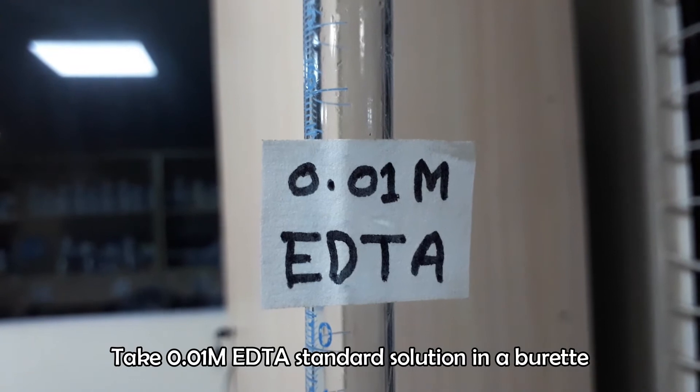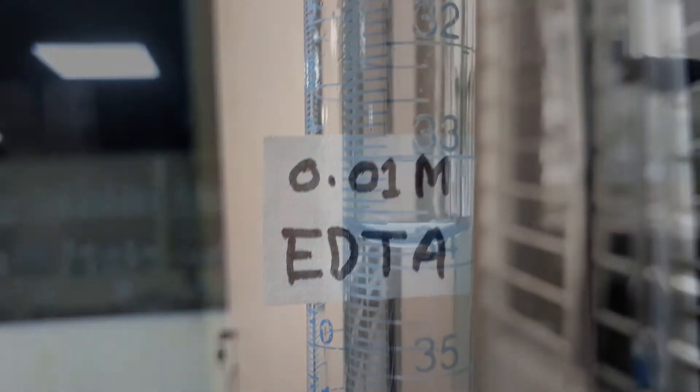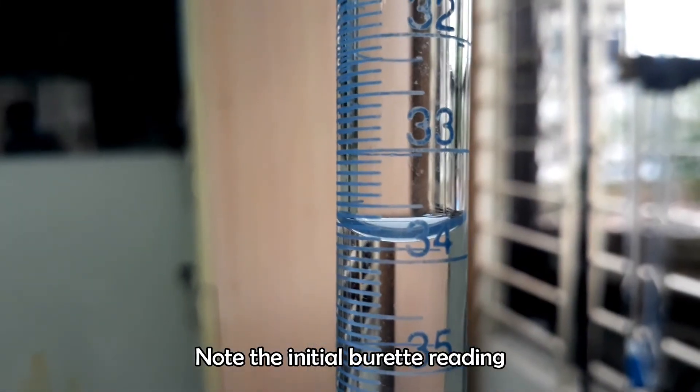Take 0.01 M EDTA in a burette. Note the initial burette reading.